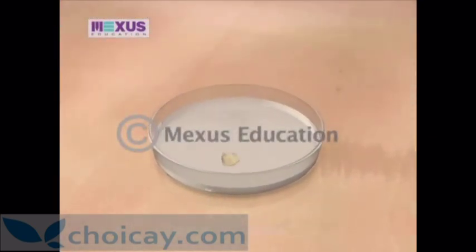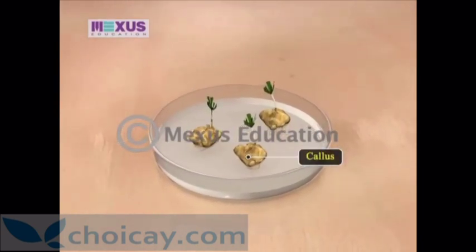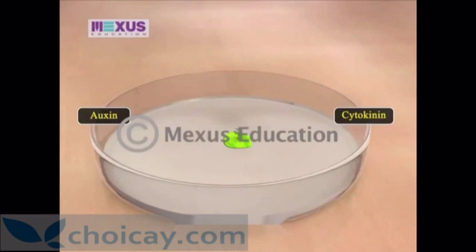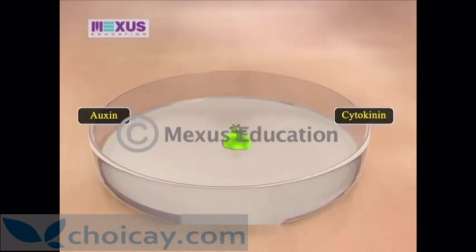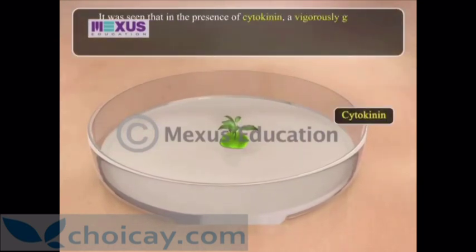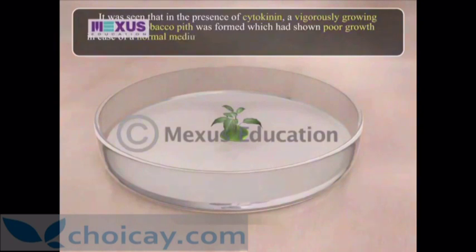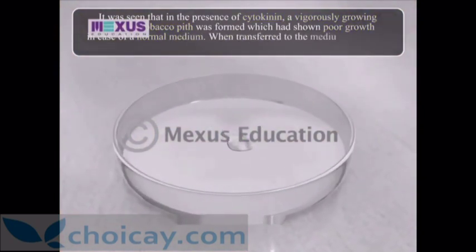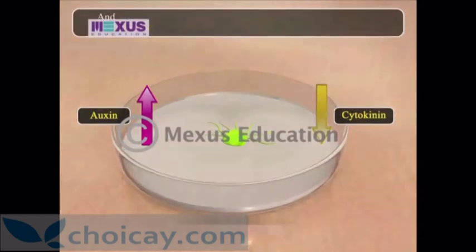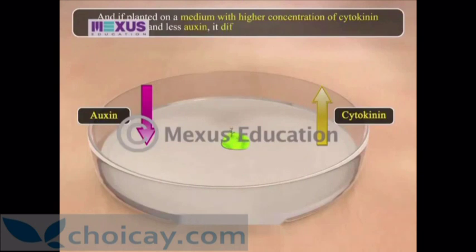The tissue gives rise to an unorganized mass of cells called callus, over which embryoids may develop and produce plants. Studies showed that auxin and cytokinin play a role in controlling shoot and root formation or cellular differentiation. In the presence of cytokinin, a vigorously growing callus of tobacco pith was formed. When transferred to a medium containing more auxin and less cytokinin, the callus differentiated only roots; when on a medium with higher cytokinin and less auxin, it differentiated only shoots.